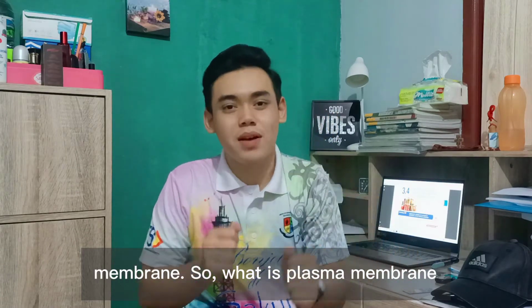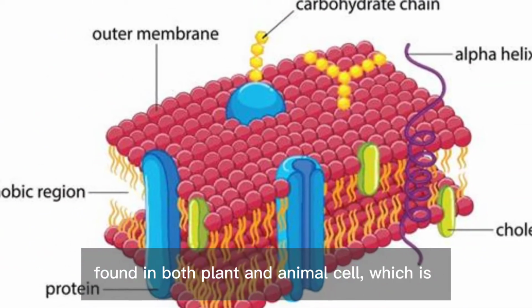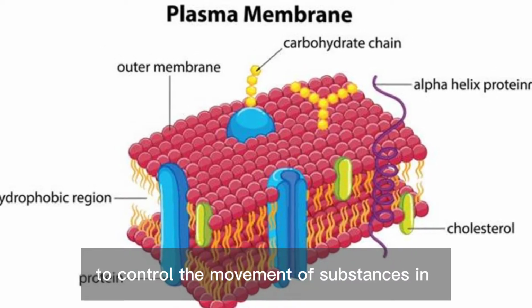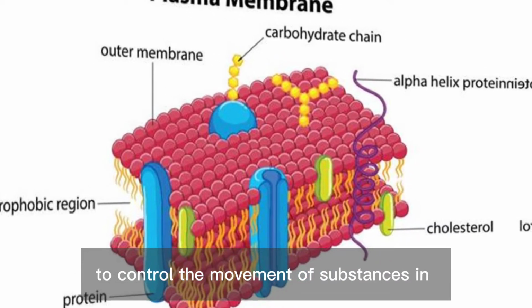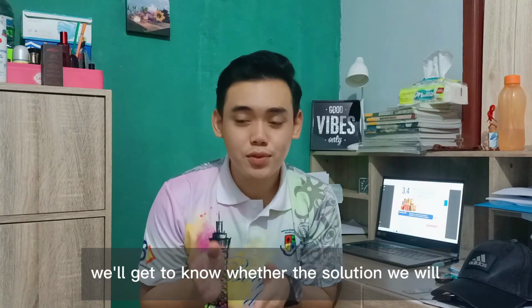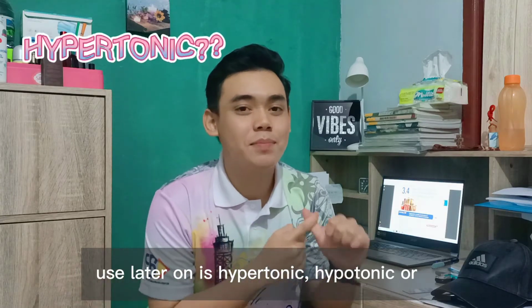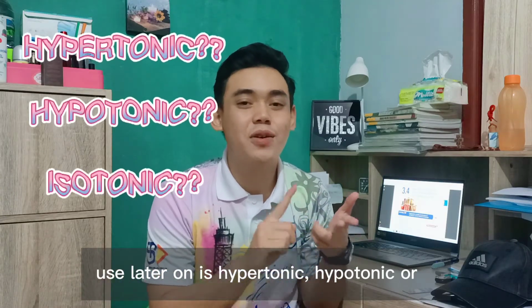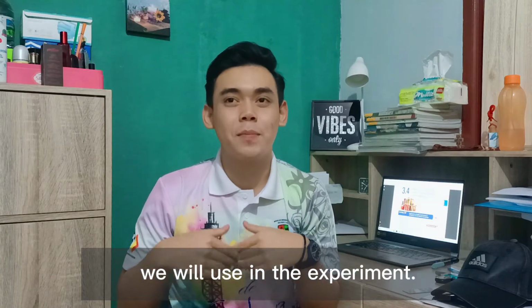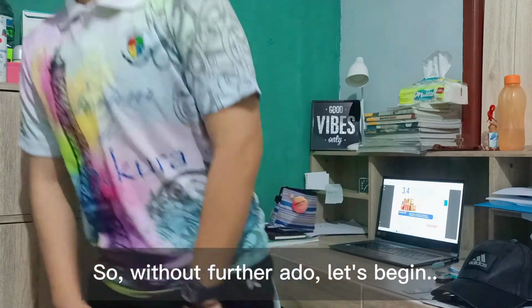So what is the plasma membrane actually? The plasma membrane is an organelle found in both plant and animal cells, which controls the movement of substances in and out of the cell. By doing this experiment, we will get to know whether the solution we will use later on is hypertonic, hypotonic, or isotonic to the mango that we will use in the experiment. So without further ado, let's begin.